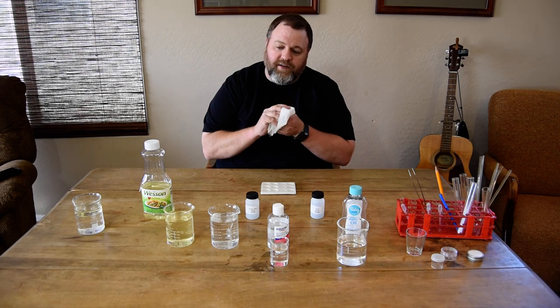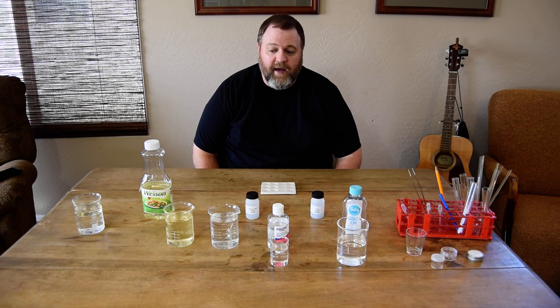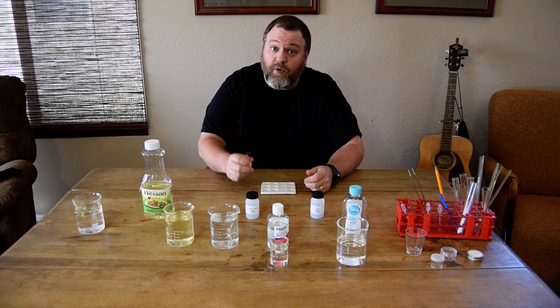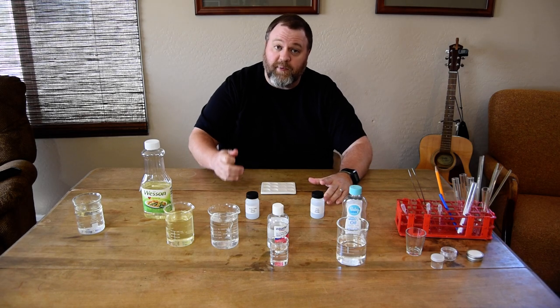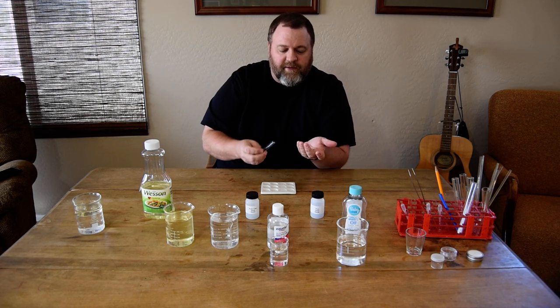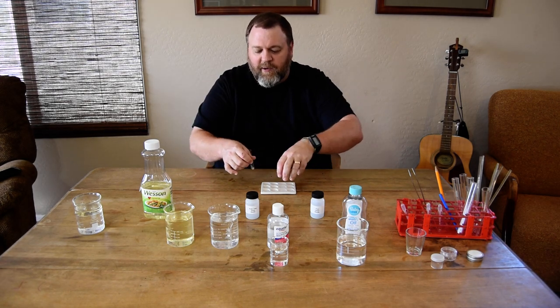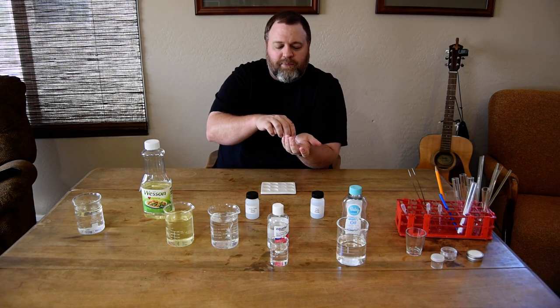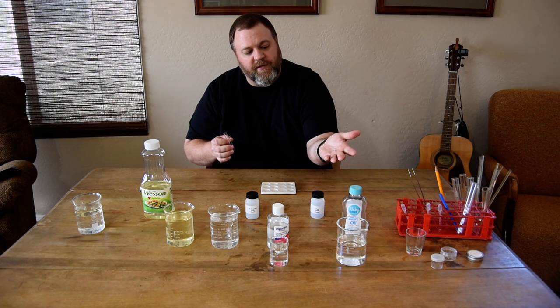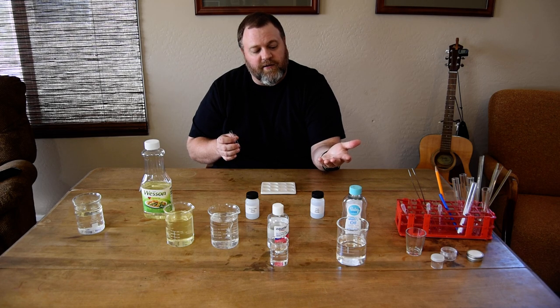So we're going to use that concept to compare the refractive indices of some glass that you have to some different liquids. Hopefully, when you did the earlier part of the exercise when you broke your glass — you took your sheet of glass, put it inside the plastic bag, and hit it with nails and broke it — chances are you have a couple of small pieces of glass that broke off. I collected them when I took the masking tape off, and I put them in this little test tube here because I wanted to use this submersion technique, where we actually submerge a piece of glass in a liquid to look at refractive index.